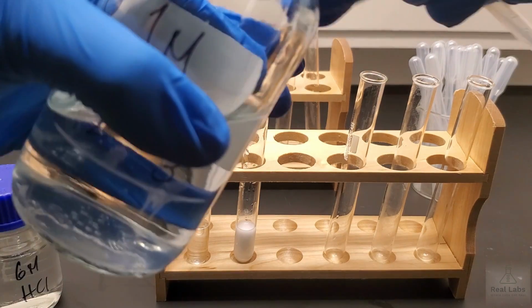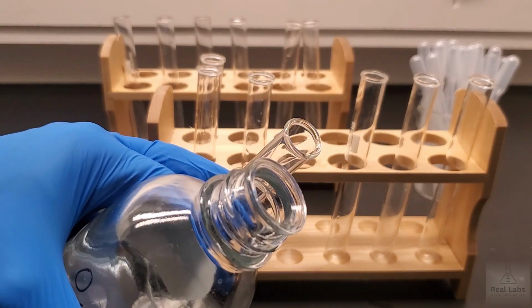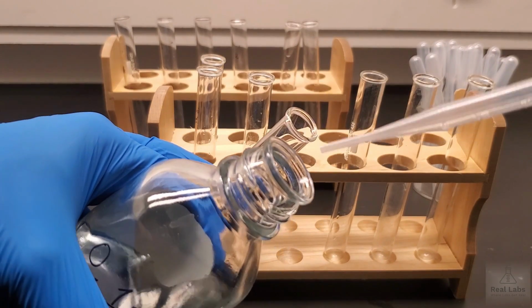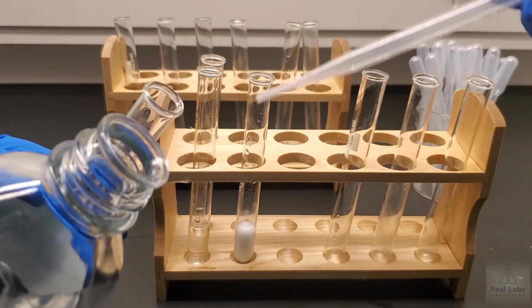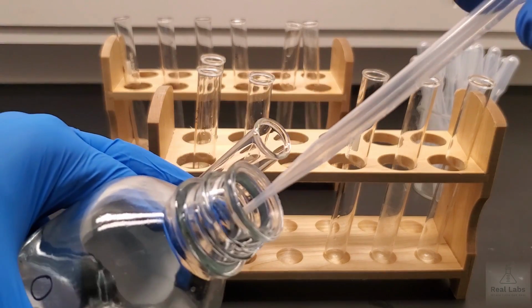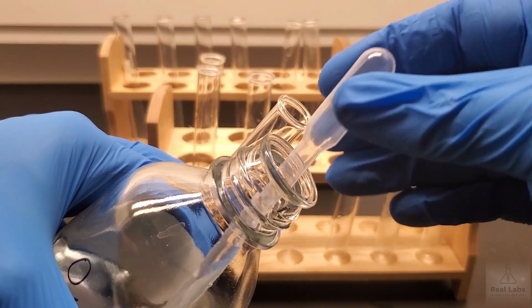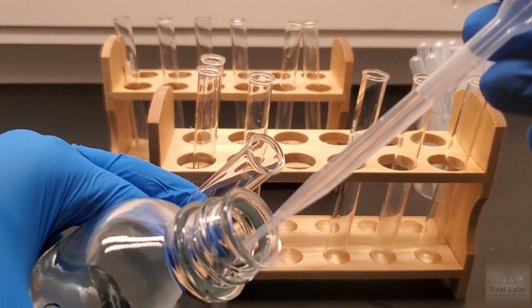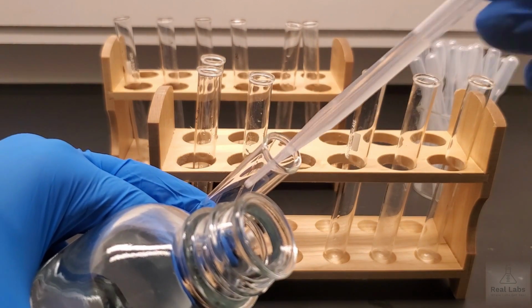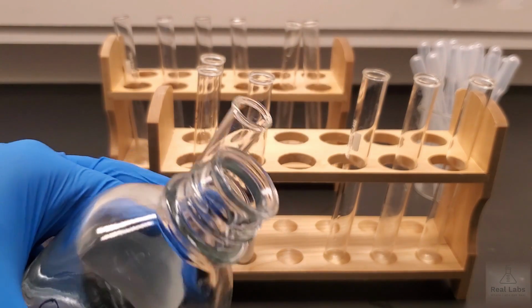And when you add, remember when you're transferring liquids, you try to keep the mouths of the containers close to each other like this, so that you only have a very short distance. You don't want to be carrying it over books and long distances. You want to just put your pipette in, get the material that you need, and with the mouth of the other vessel being very close, it's a very short transition period, less likely to put drips all over the place. And now we've added our sodium carbonate.